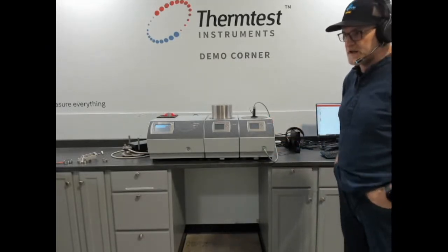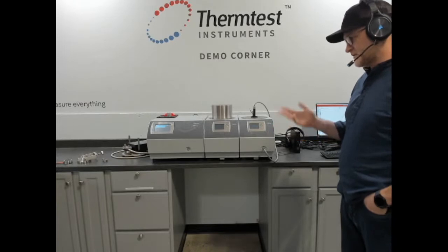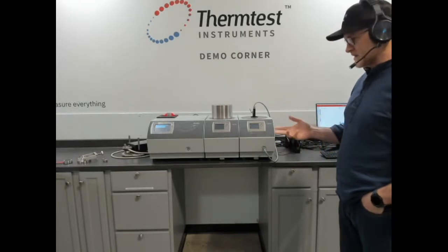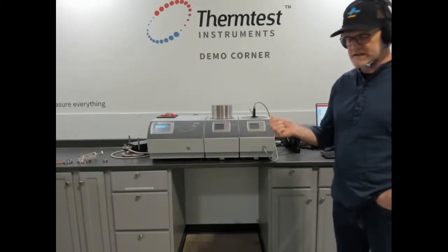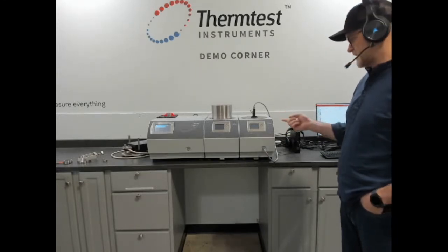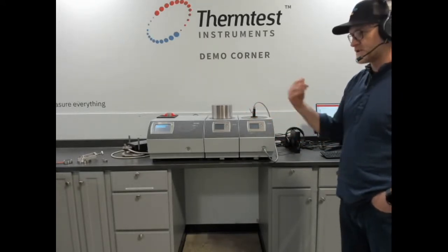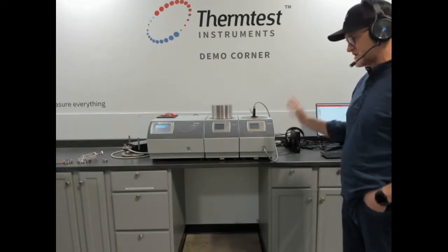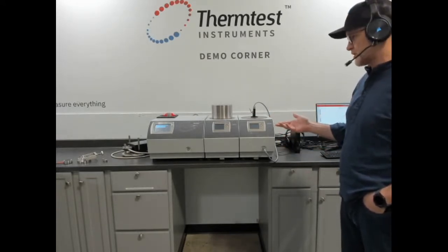methods that are primarily designed for the absolute measurement of thermal conductivity, diffusivity, specific heat, and thermal effusivity for solids, pastes, and powders by transient plane source, the ISO, as well as liquids by the ASTM for liquids, 7896, as well as transient line source, ASTM D5334 and 5930, and transient hot strip. What is unique about this, the MPV, which has these very same methods, the MP1 has it basically across the board in terms of specifications and capability, much more advanced features in measurement terms.